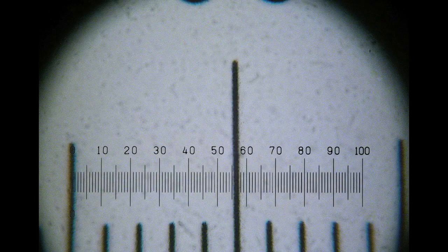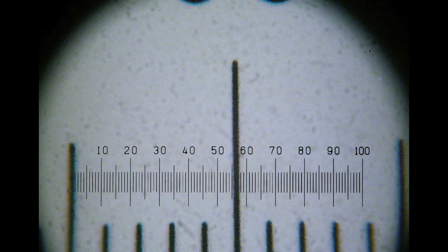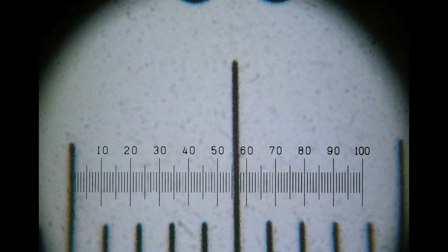Now there are less than 10 slide scale units clearly visible. And here I'm going to say that the 100 point on the IP scale crosses the slide scale at the 8.8 slide unit mark.